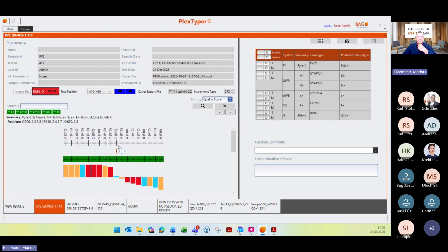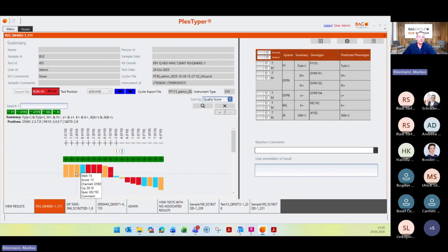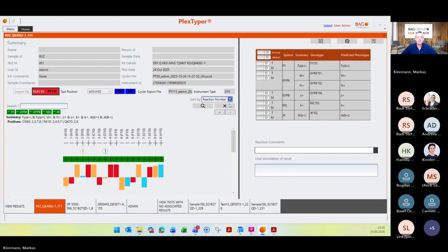Here the positive reactions, the negative reactions, and here in green, the internal amplification control. And then you see these different colored bars. These colors stand for the different fluorophores we used in this assay. So the orange 560, the quasar, and also the red 610. And then you can see that the bars are ordered by the quality score. You can switch this to the reaction number. So it goes now from 1 to 8, or from A10 to H10, so that you can guide over these different reactions.